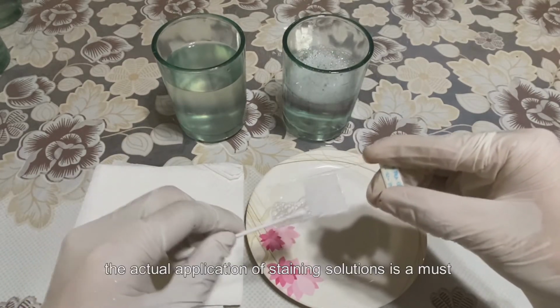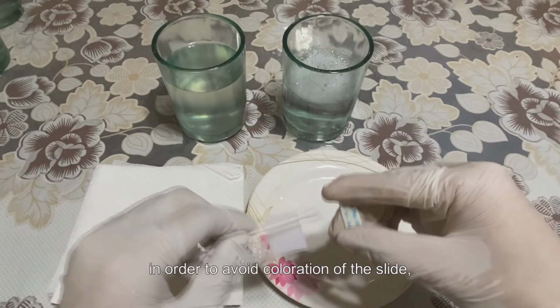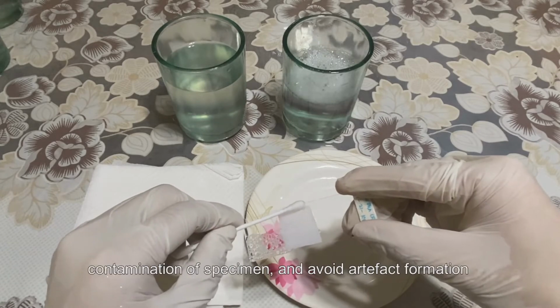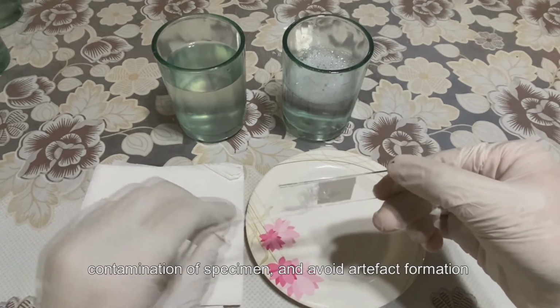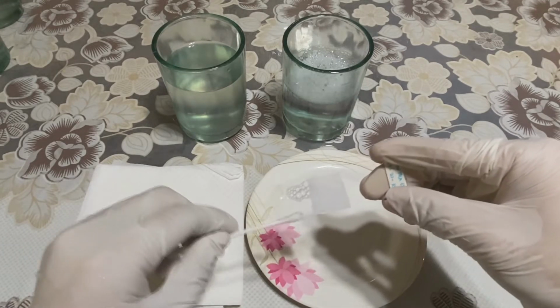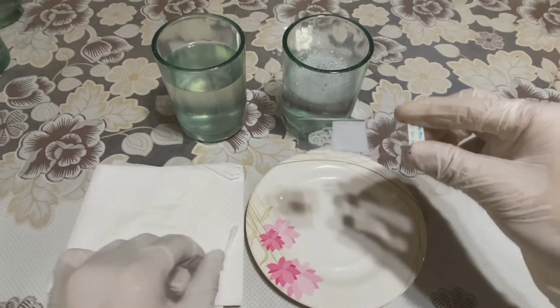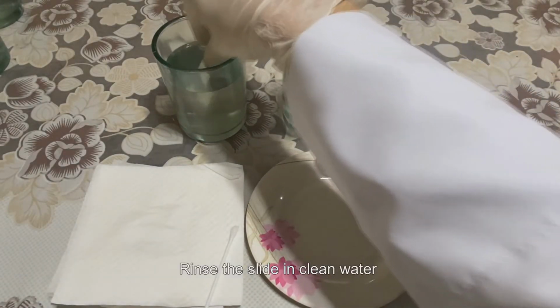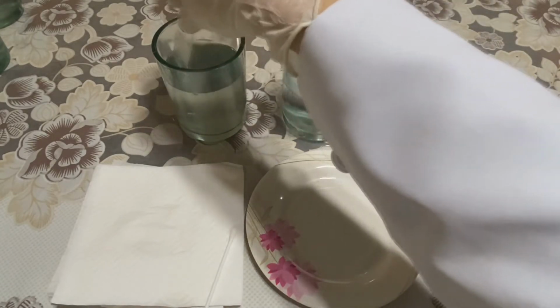Cleaning the slide before the actual application of staining solutions is a must in order to avoid coloration of the slide, contamination of the specimen, and avoid artifact formation by the reaction of the adhesive on the free spaces of the slide. Rinse the slide in clean water and drain excess water using paper towels.